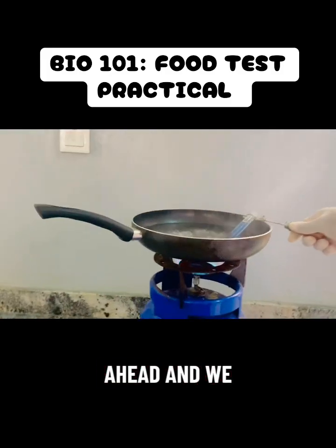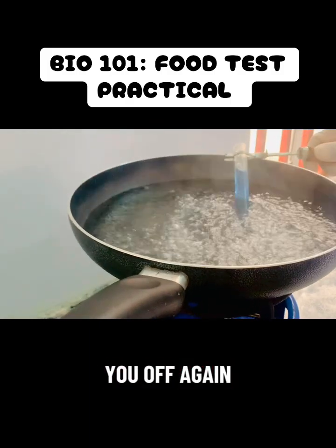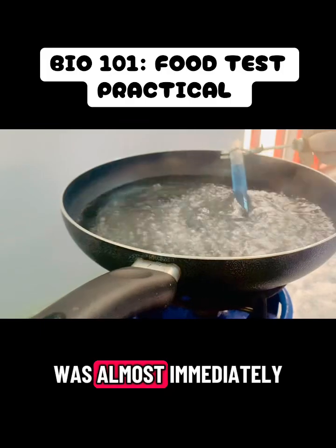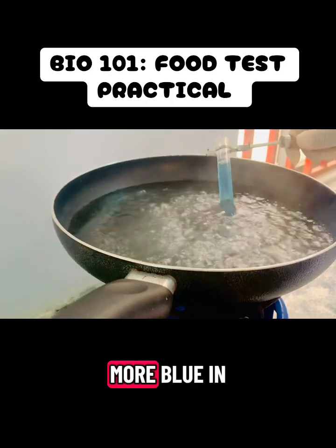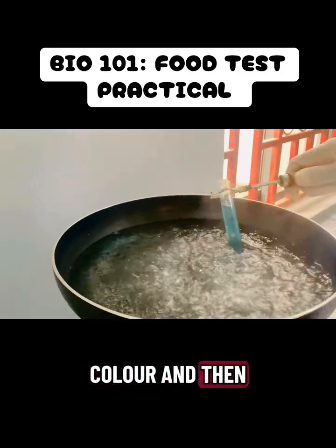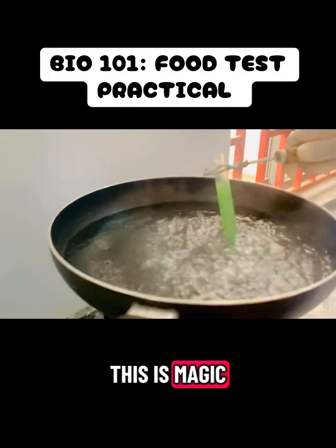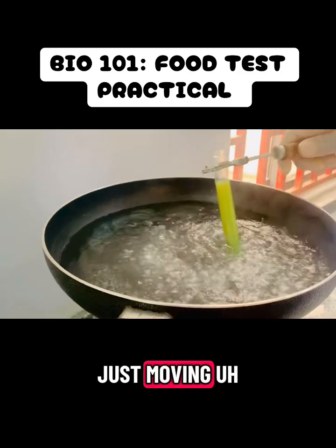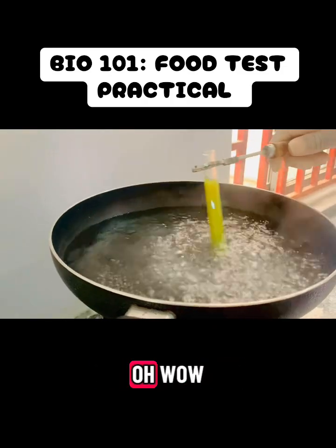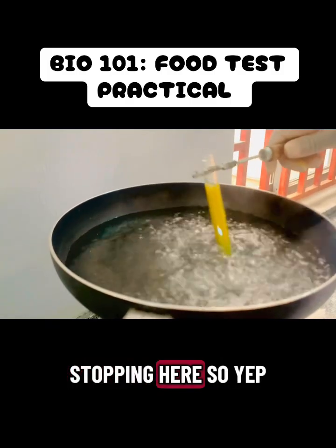So we go ahead and we heat it, and guys, let me tip you off again. This color change was almost immediate, like rapid. So you could see it became more blue in color, and then it begins to move. Just watch that. Can you see that? Wow, this is magic. Oh, well, it's science. So this is it. See, rapidly just moving from 0 to 100. And oh, wow. So we are seeing a different color change, but we are not stopping here.